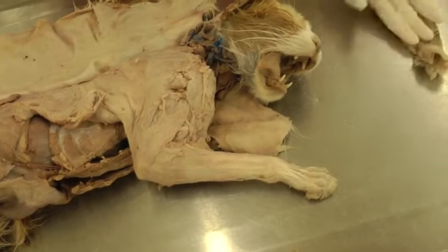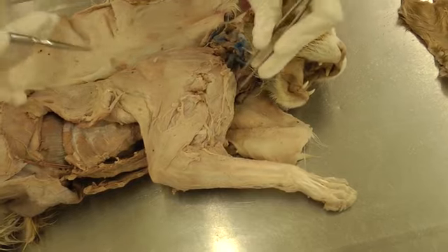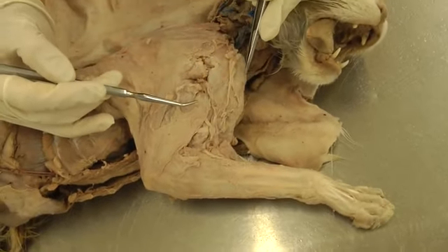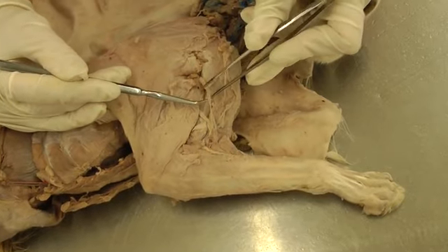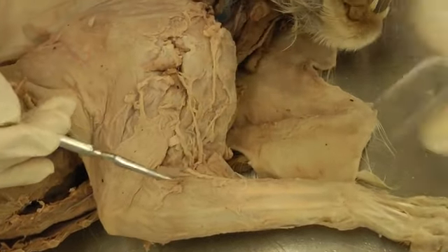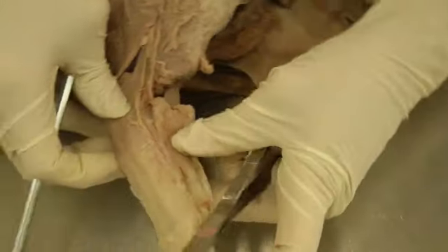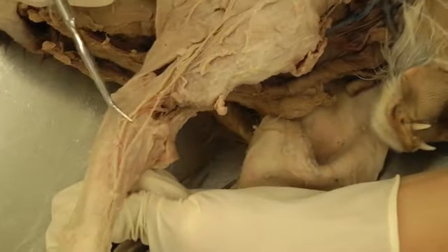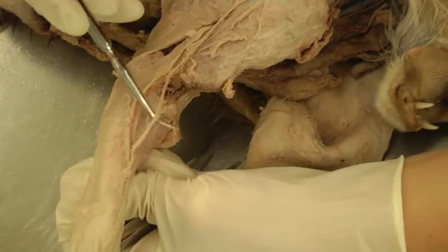Just take that off. Unfortunately this cat does not have a lot of injection for the veins, so it's very difficult to find and follow — and you might have a similar situation. Try to look for the cephalic at least, which should be on the cranial aspect here. Mine is not injected, so it's just this right here.